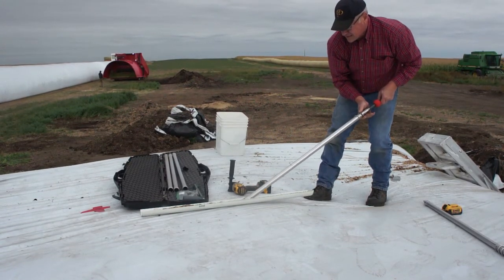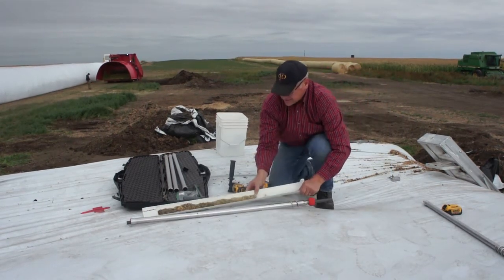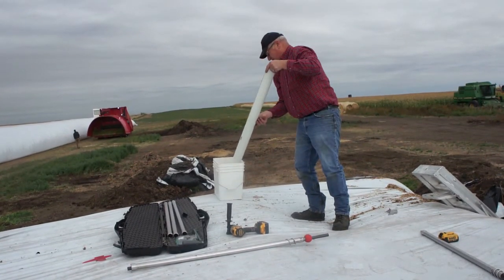Lay it out and have a look to make sure there's no dirt in it. If you see some mold or something like that, you can go back and take more samples to see how extensive it is.